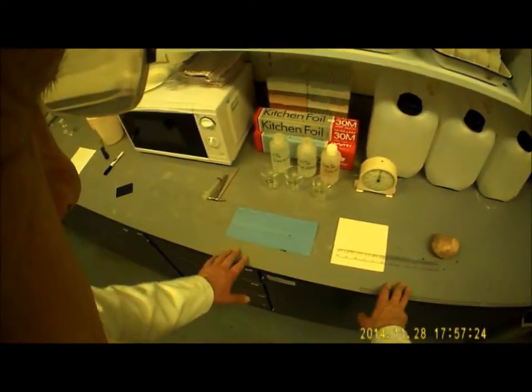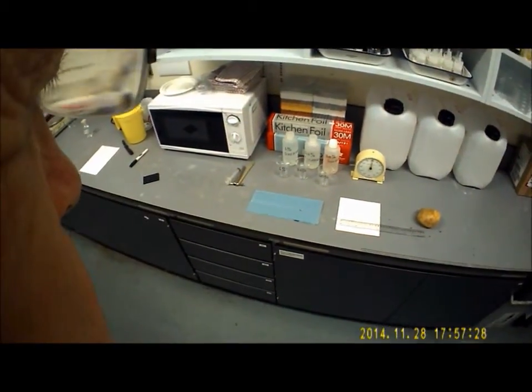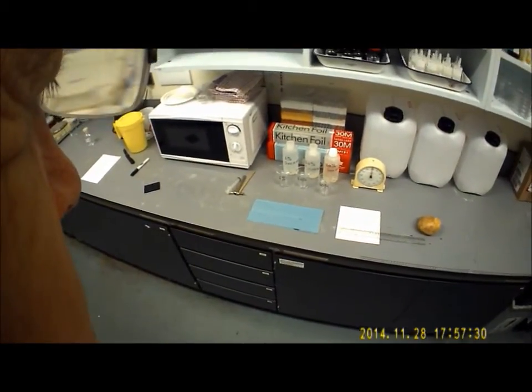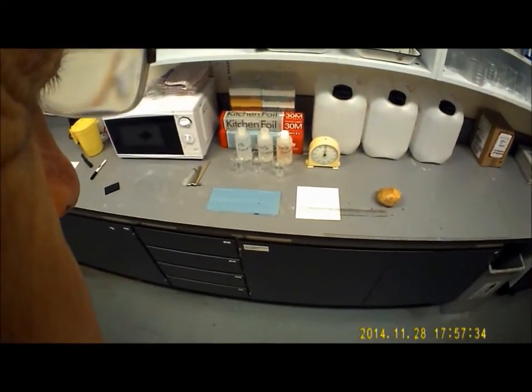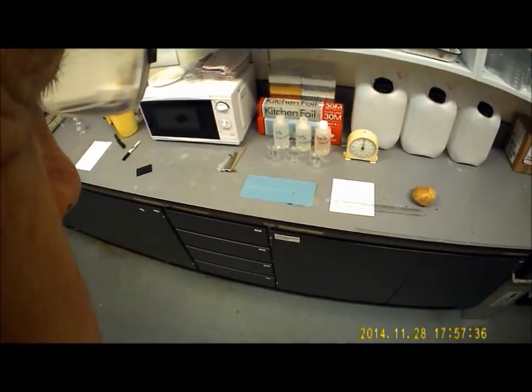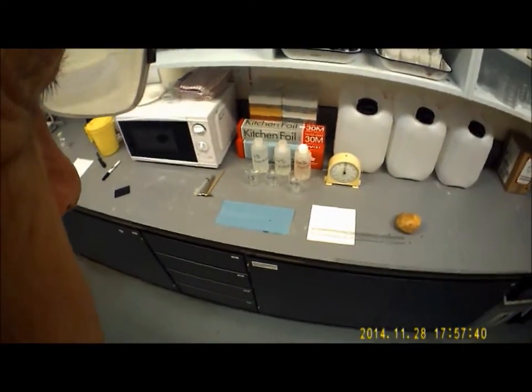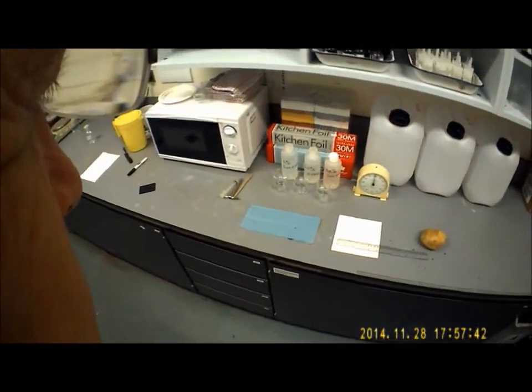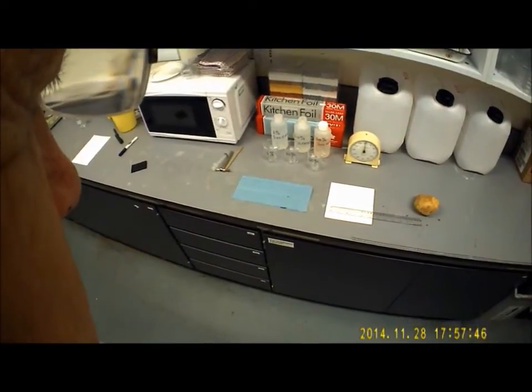In this practical, you're going to be examining the effects of changing concentration of a sucrose solution on the rate of osmosis in or out of cores of potato. This will test your understanding of the processes of osmosis and the meaning of concentration gradient.